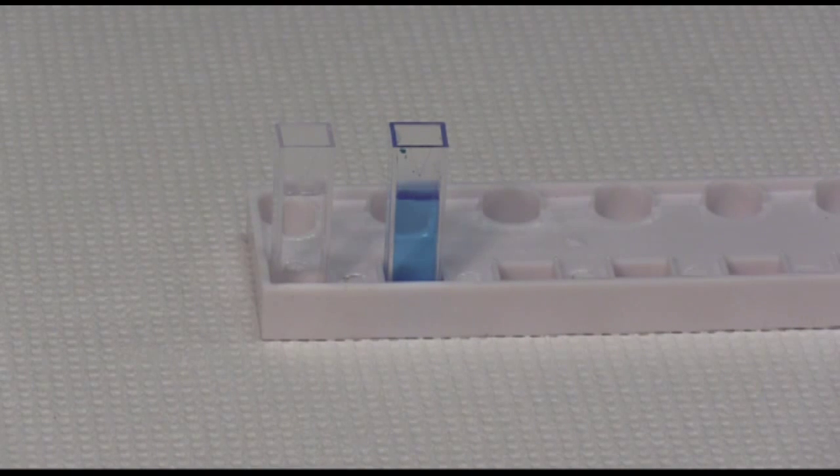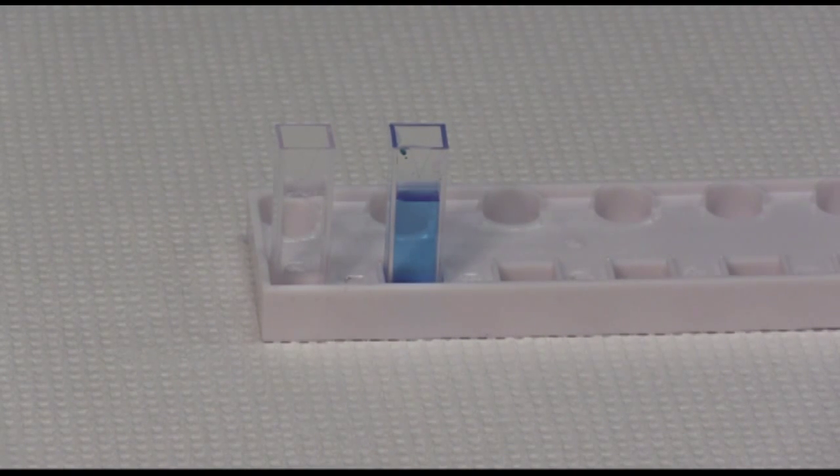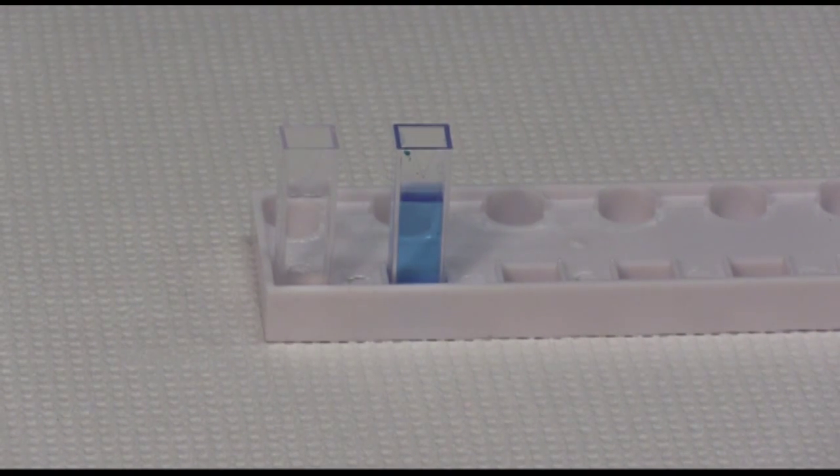To measure samples in the spectrophotometer, we'll be using cuvettes. Every type of cuvette is different, so make sure you understand the one you'll be using in your lab.